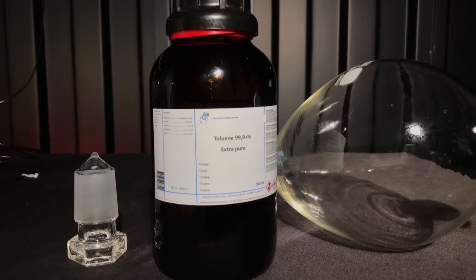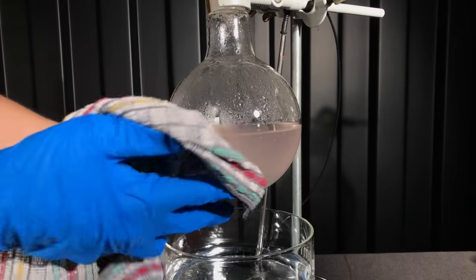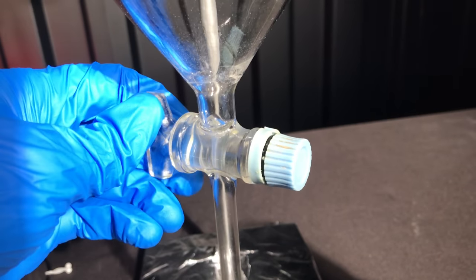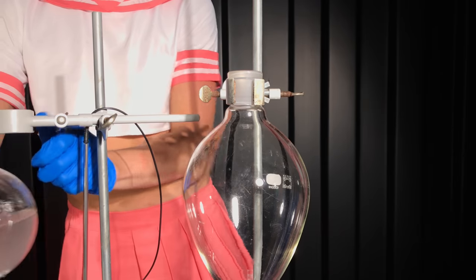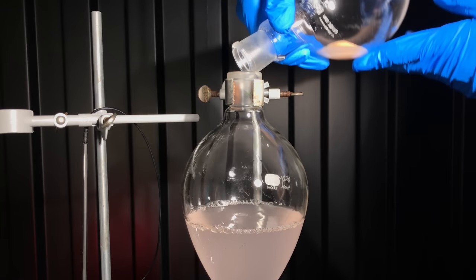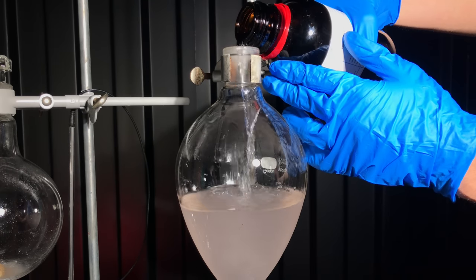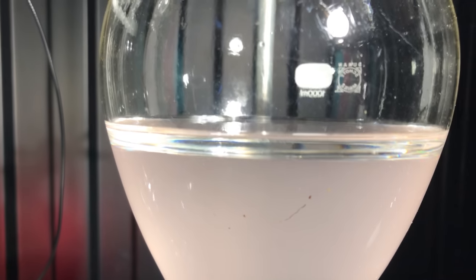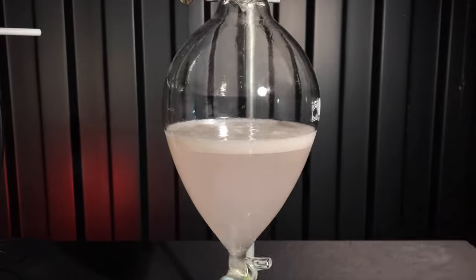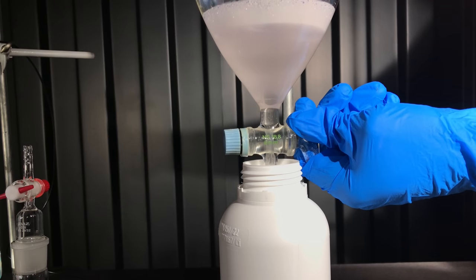For the extraction I began with toluene, which was a mistake. As it turns out, estradiol is poorly soluble in it. Fortunately, the other chemicals in solution won't get extracted by toluene either, so after two extractions with toluene, three more were performed with diethyl ether, which is suited for estradiol, and the layers were then combined. Estradiol is very soluble in alcohol, but alcohol is water soluble and thus unsuited for a two-phase extraction. To extract, you add the solvent to the funnel, shake it aggressively, and then drain off the layer you want. Repeat as often as desired.